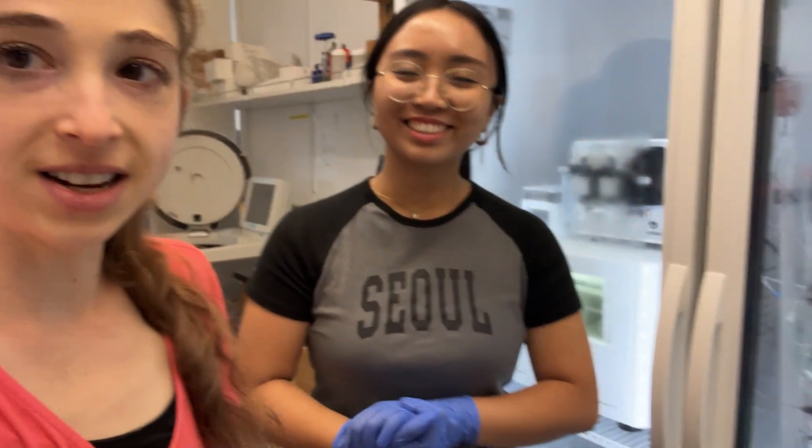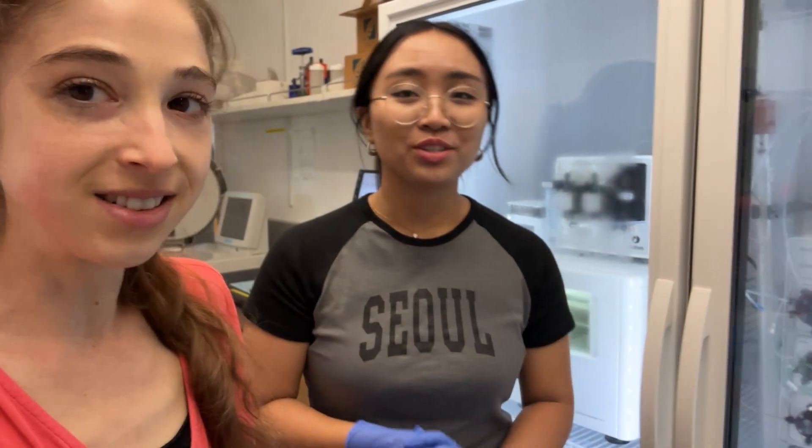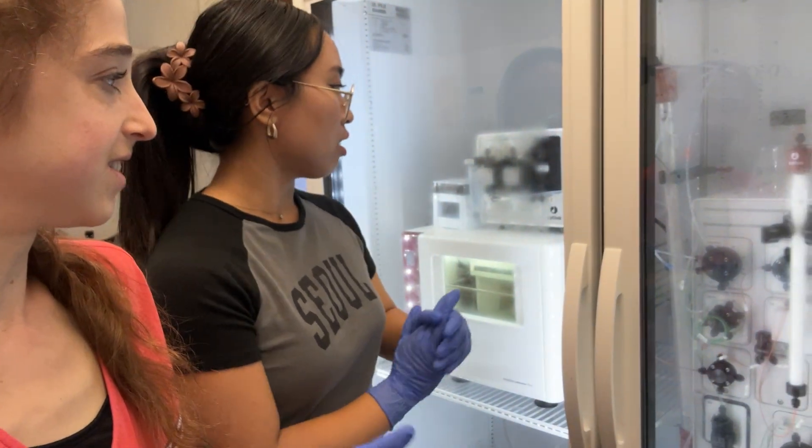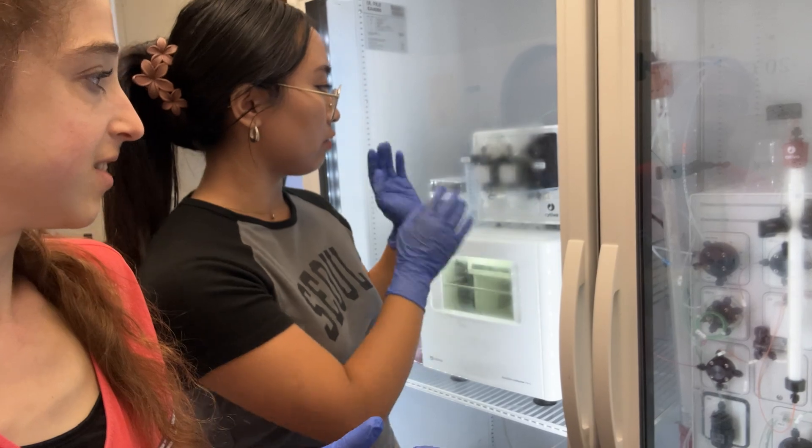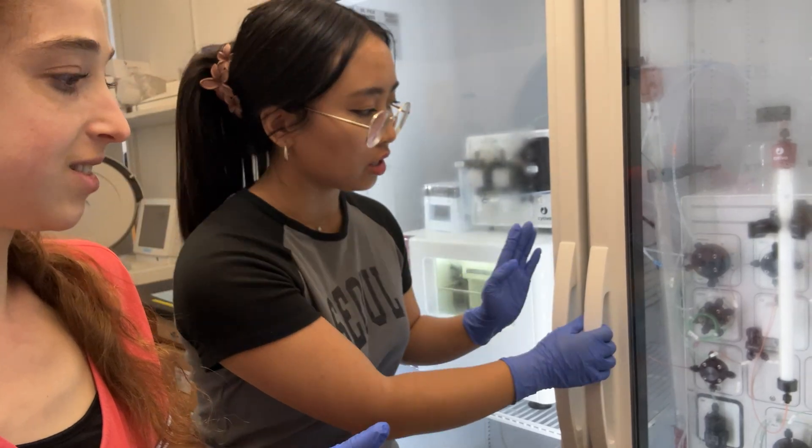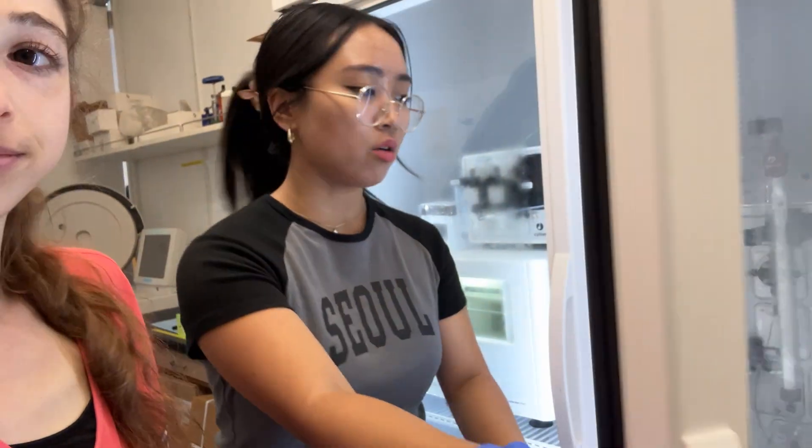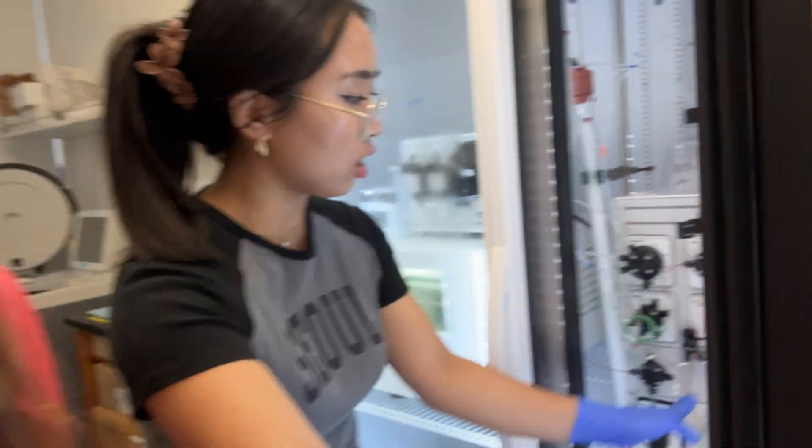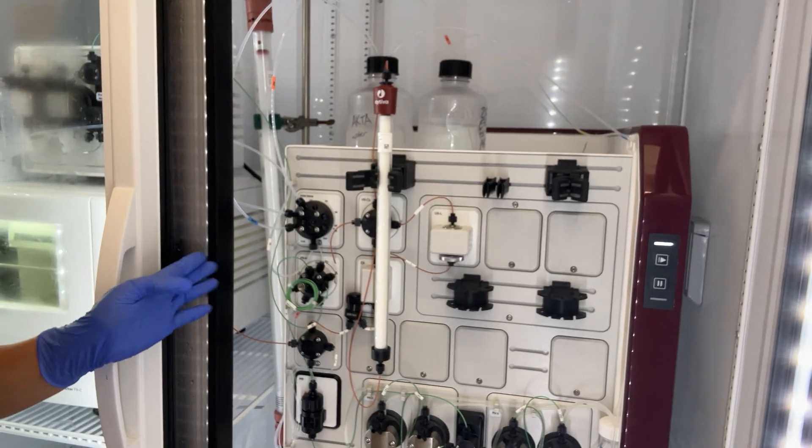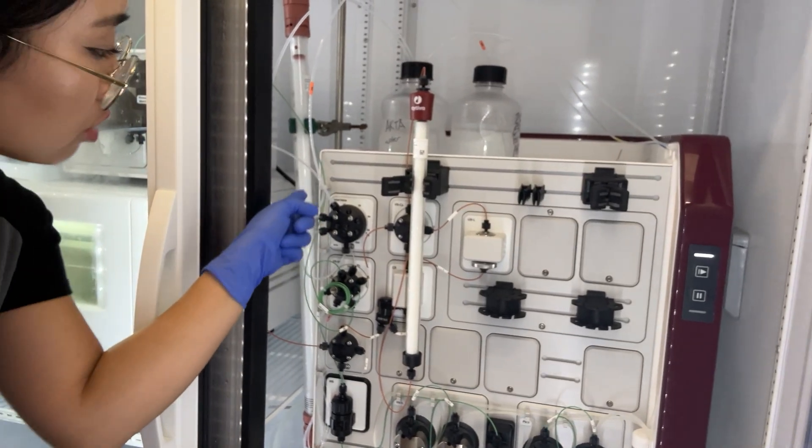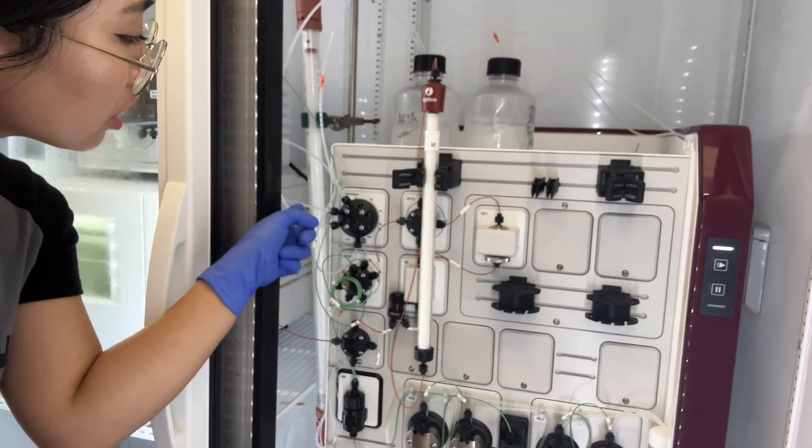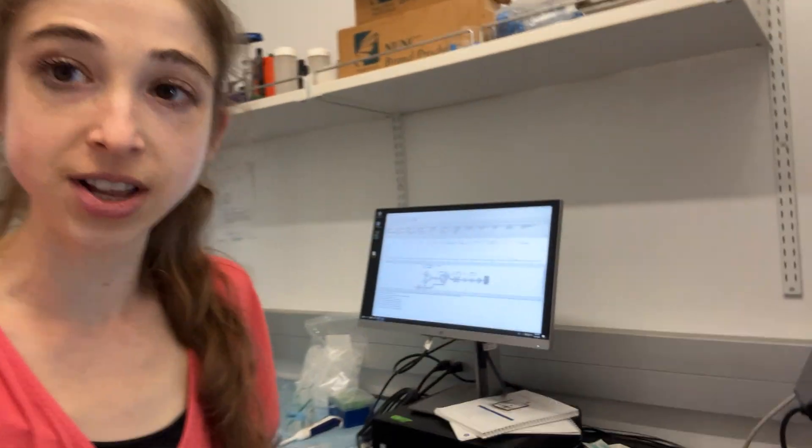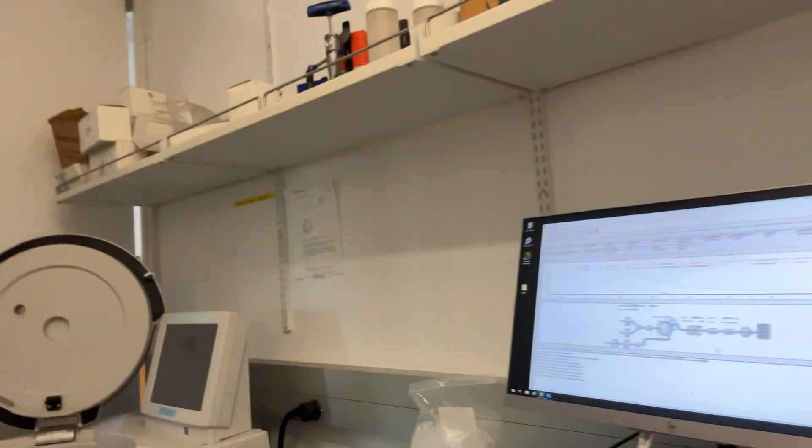Okay, Karina, what's today's lesson? So today's lesson is to make sure that we always have our fraction collector washed. So not only have our column washed, we also have our fraction collector washed here. It's new as you can see here. Exactly. So it's really easy to forget that you need to wash that fraction line too.